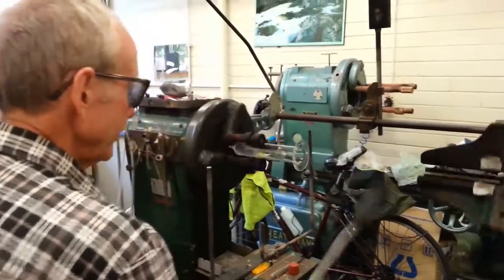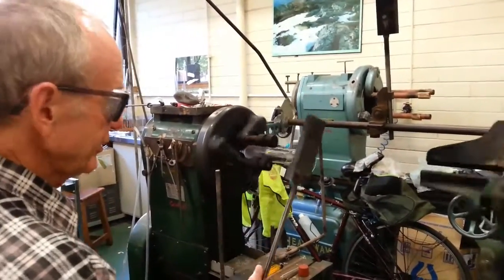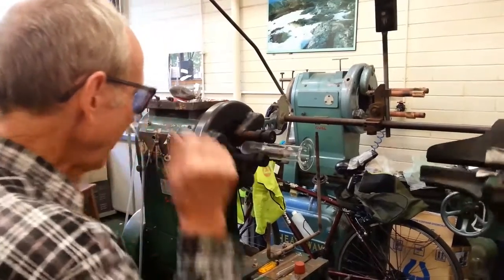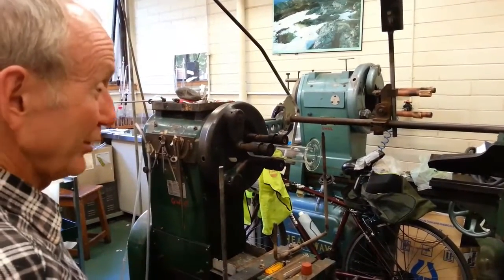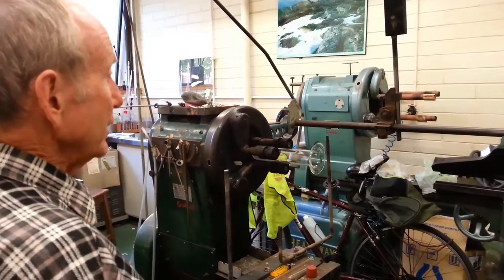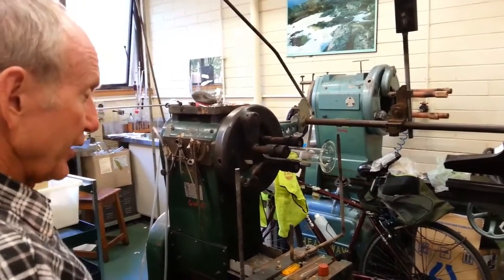And what I'm using on this lathe is carbon tools. Carbon doesn't stick to glass when the glass is hot. When the glass gets hot, it's quite sticky. The hotter it gets, it can get a viscosity more like honey when it gets very, very hot.